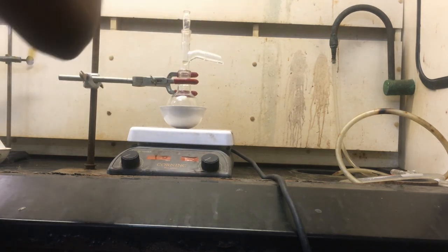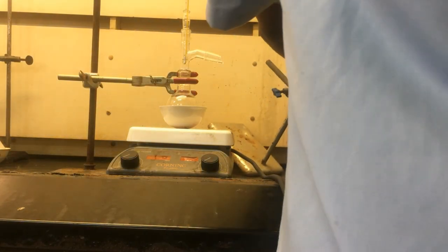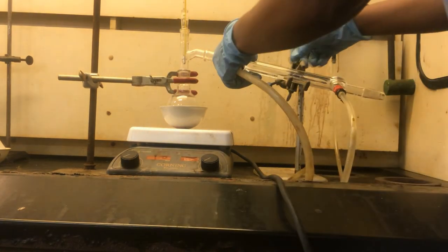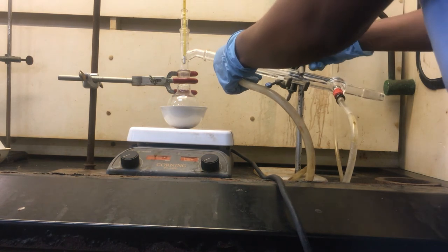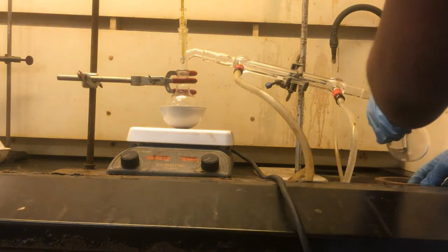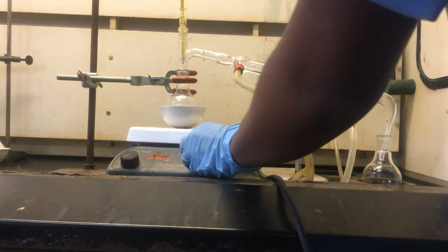And this is how we assemble the apparatus for distillation. The condenser is a vital glassware during this process. Essentially the vapour is cooling with the condenser and this converts the vapour to liquid. And as you can see in our flask number 2 it forms the distillate.